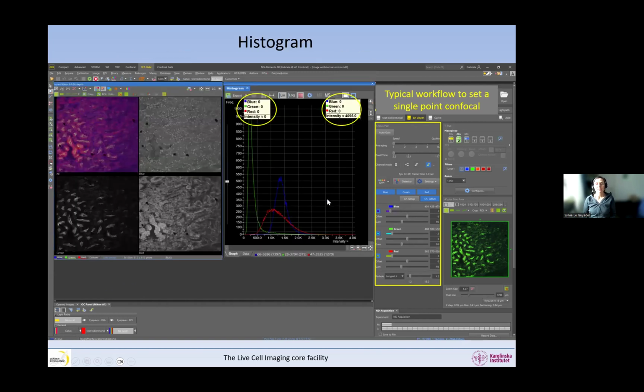But anyway, once I have changed all the settings, I now have a correct histogram where I'm using the whole histogram, but I have no underexposed pixels and no saturated pixels. And if I do not push the brightness and contrast, this is what the image looks like. And you can see that it's very different from before. So make sure that you have no saturation at all and no underexposure at all in the areas of interest. And so in the areas of interest, it means what?